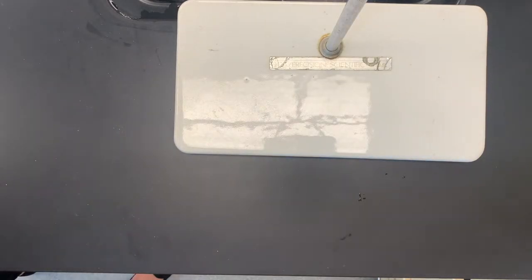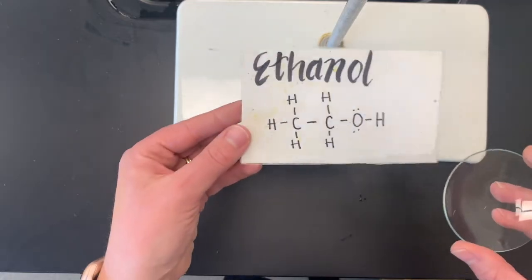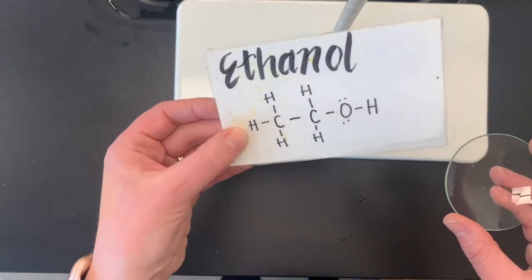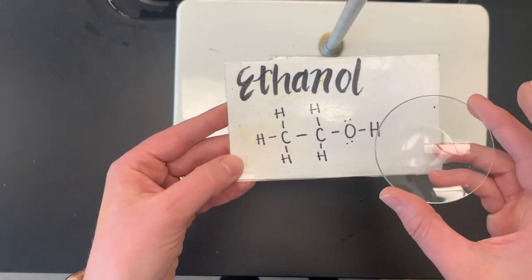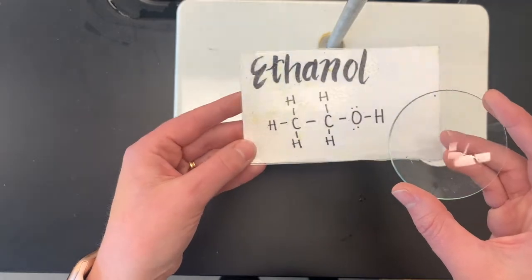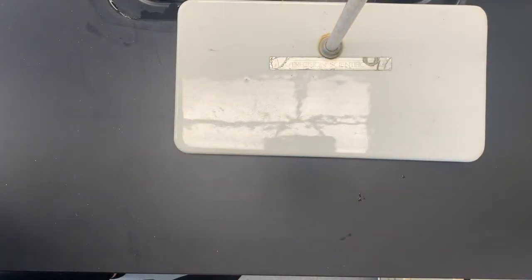Next we have ethanol, which you might have heard of. So there's one molecule of ethanol. And this is from a lab a couple years ago, and I don't know what got on it. So I'm definitely going to wash my hands. There's some ethanol. And it has been evaporating. Hopefully I can do this lab quickly enough that it doesn't all go away.